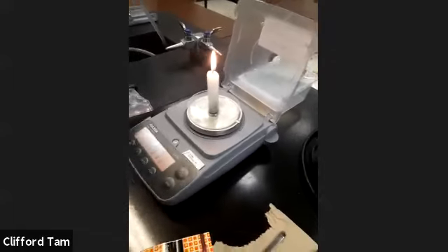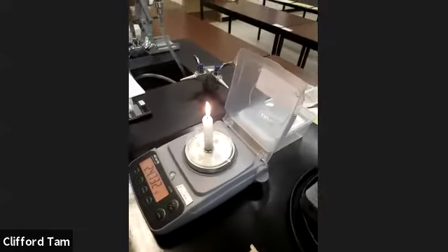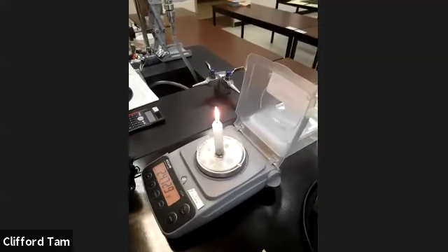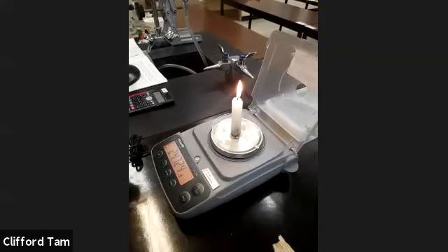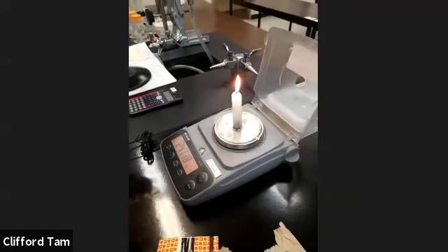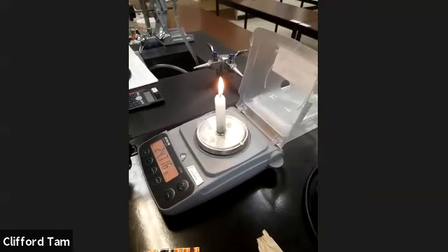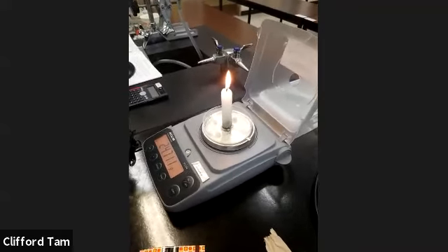So we're just going to tell you at 60 seconds approximately what mass it is, just so that you guys can have a reference. And you notice it's fairly slow. You have about 0.01 of a gram drop every single second or so. Okay, and we're going to compare this to another fuel that we like to burn so much. That's 1 minute, 24.710.